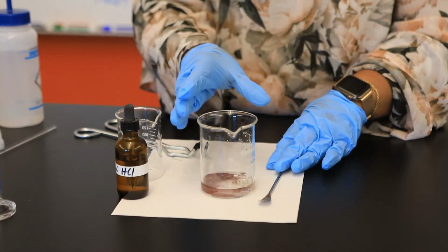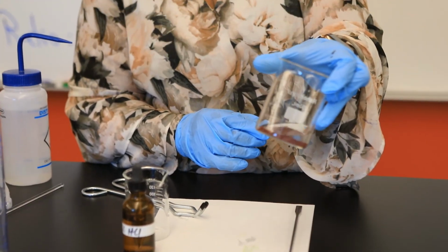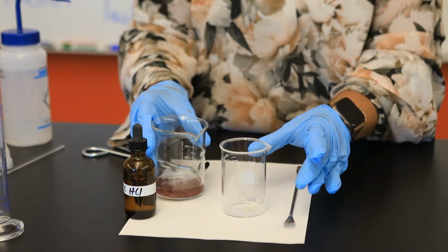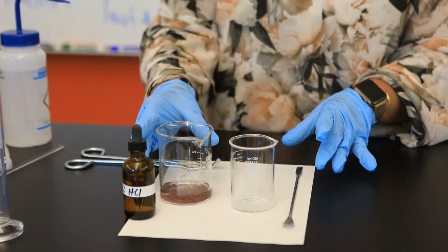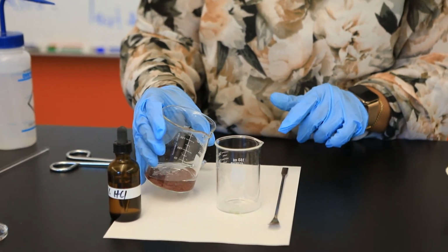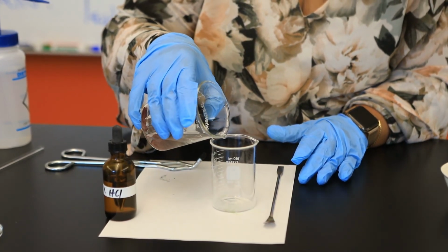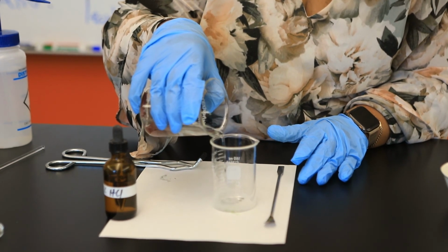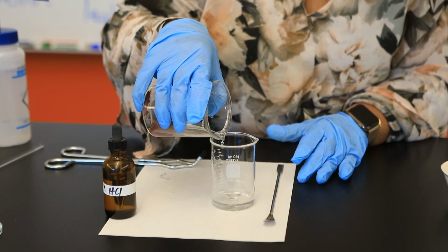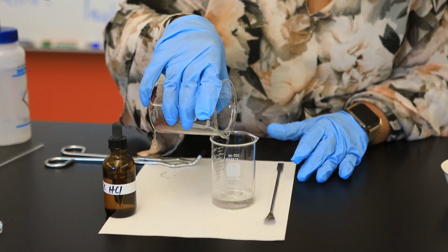Now, in this final step, I have to recover all of this reddish brown solid, which is copper. And so to do so, I'm going to go back to one of the techniques that we talked about earlier in this term. We're going to just decant the solution. So after settling, I'm going to slowly decant that zinc chloride solution. The goal here is to avoid transferring, which is going to be a bit of a challenge, any of our copper metal.